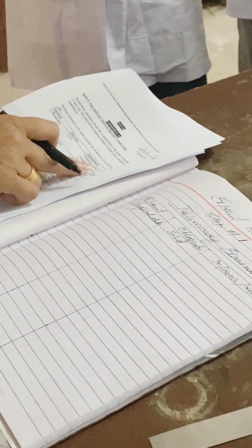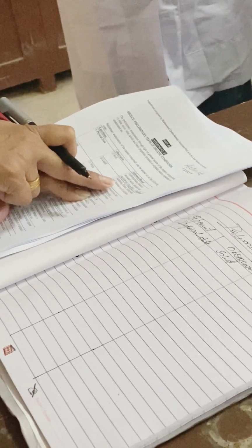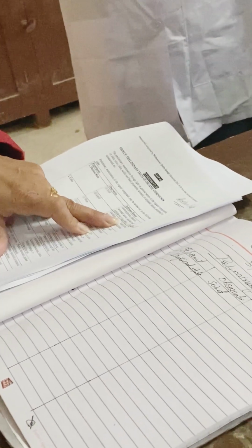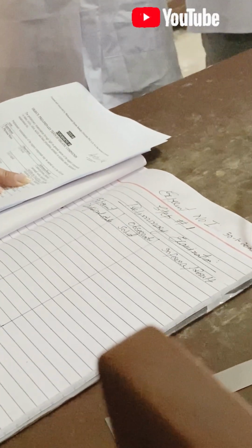Okay, fine. So now under the category of solids, which compounds come? They are saying carbohydrates, phenols, aromatic acids, amides and anilides only. I have added a little sentence, may be present, right? Because this is a preliminary examination. This is a very initial examination. This is the very start of knowing this compound. Though we know it is para-nitroacetanilide, why have I given you a known compound?